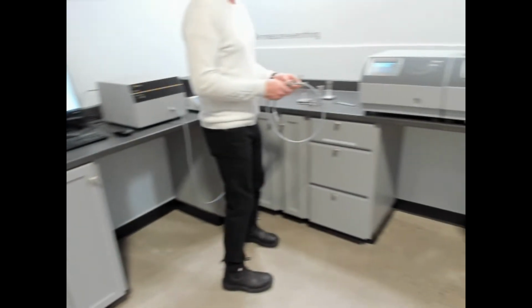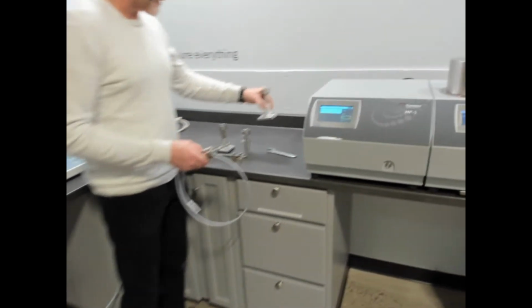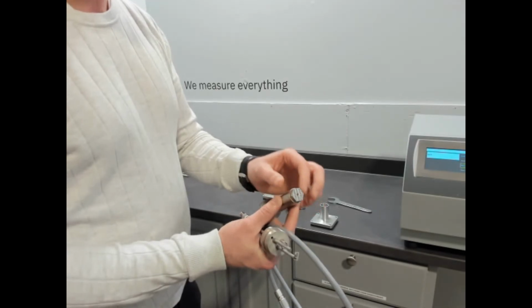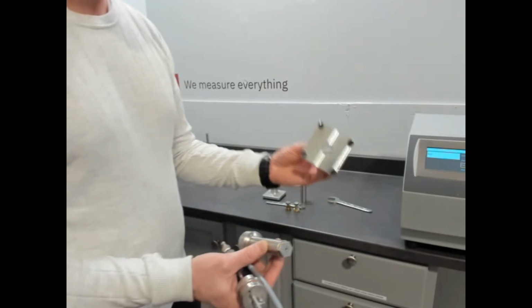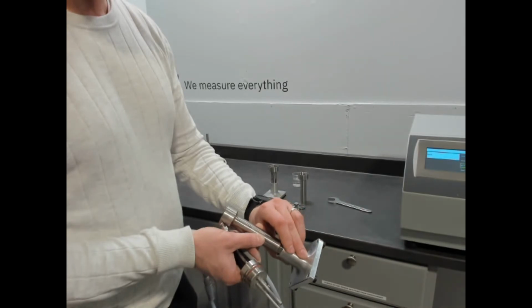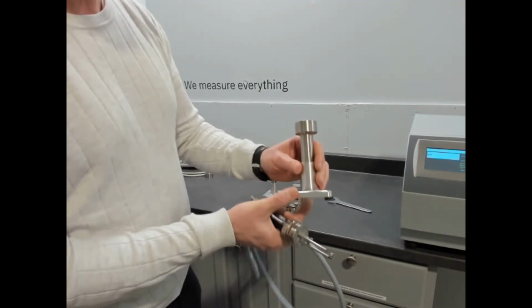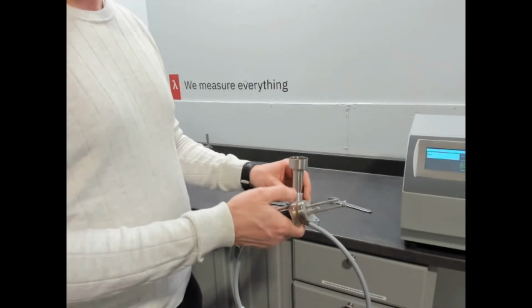So we're going to bring the camera in a little closer so we can show setup. When you buy an MP-1 with THW method, you get a cell. This cell has some convenience elements. It has a nut pattern on the bottom. And as you can see in this holder for the cell for loading it, there's a nut pattern. That's so when you disassemble the cell, that can be pushed in there and affixed so that when you turn it off, you have something to hold on to. So it gives you two mechanical movements so that you can release the cell.